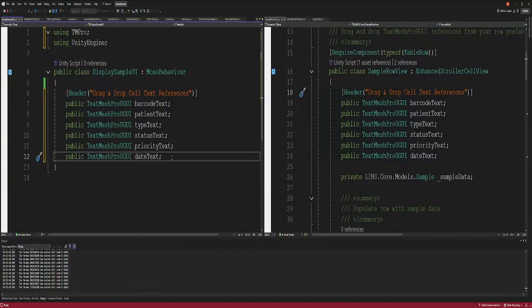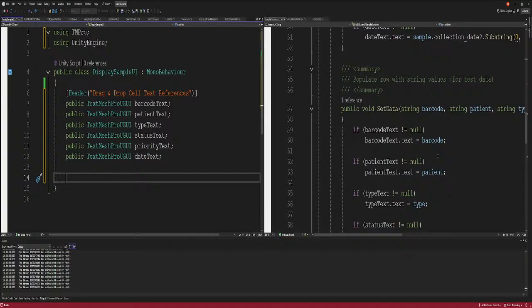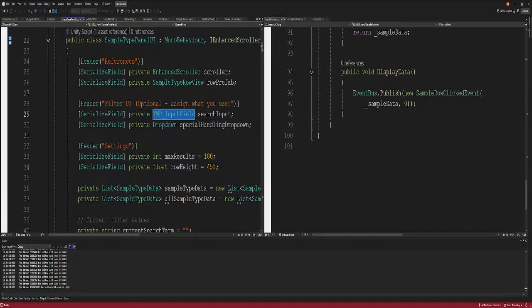Yeah, you're right. It is like we're rehashing a lot of the code. I get it. But the problem is we have to separate the scripts, because the less code we have, the fewer bugs, which is true. But we have to differentiate what's a prefab and what's a display type of thing, because they may be different and they may be the same. But yeah, let's give that a try. So sample display, save it. But like you said, you are correct.